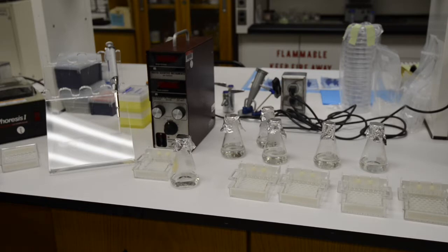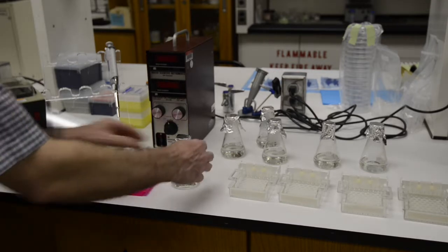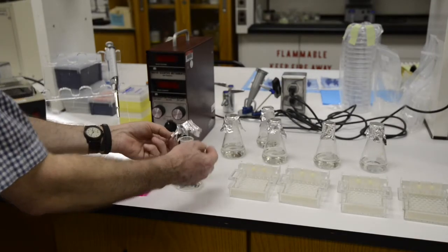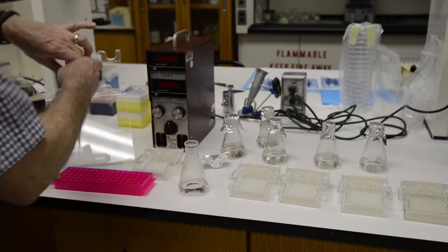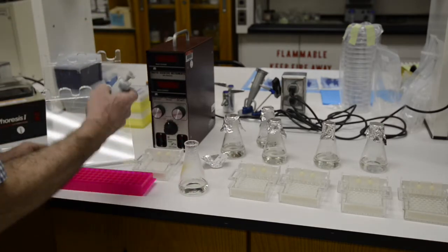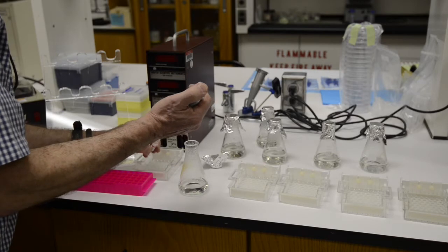Your instructor will have provided you with a flask containing 50 milliliters or approximately 50 milliliters of 1% agarose. This has been boiled and you should allow it to cool until you can handle the flask with your bare hands.